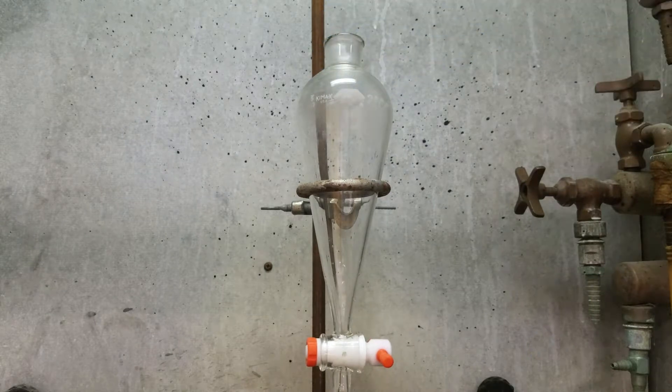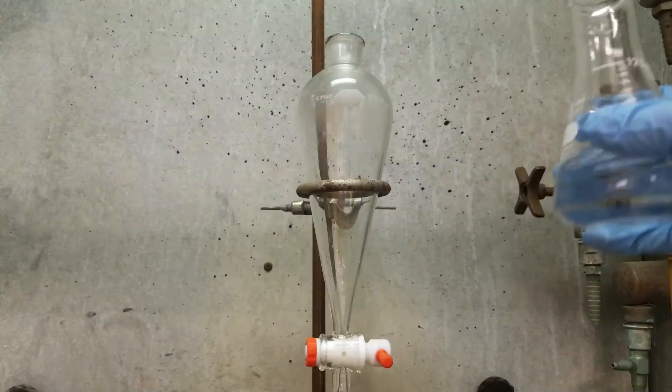Before adding any liquid, remember to check that the stopcock is closed, then add the two solvents into the separatory funnel.